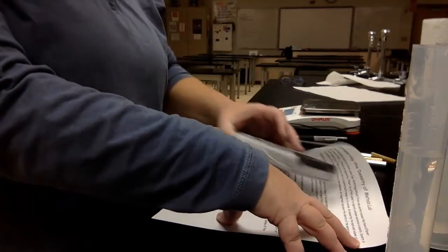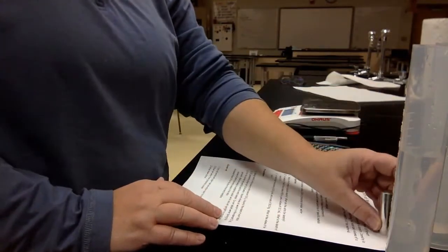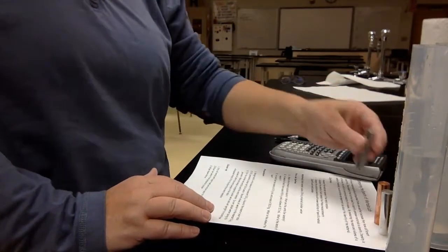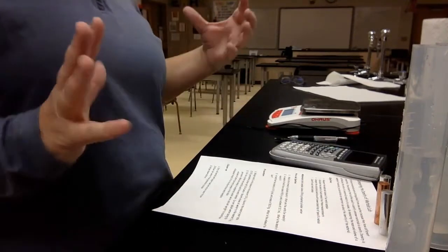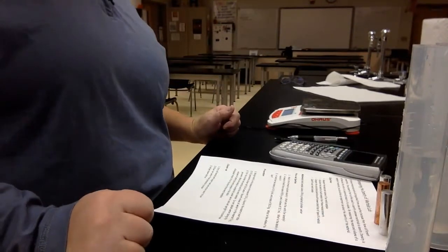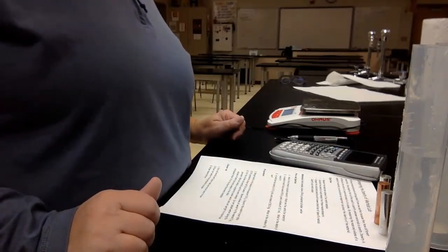Okay, today we're going to do the lab comparing the density of different metals. We can use density, if you recall, to identify if an object is lighter or heavier than water. Each metal has its own specific density based on how compact it is, how much mass is in that given space. Okay, so different materials can be distinguished from one another because they have different properties.